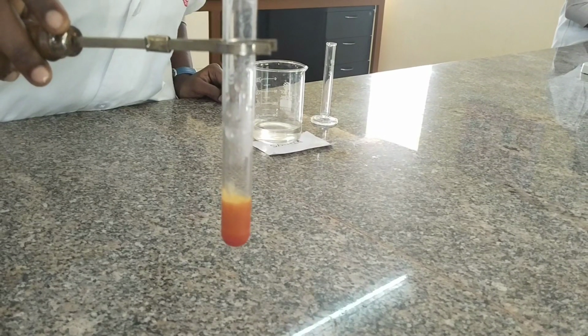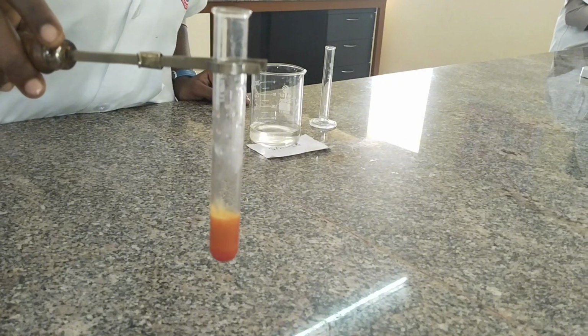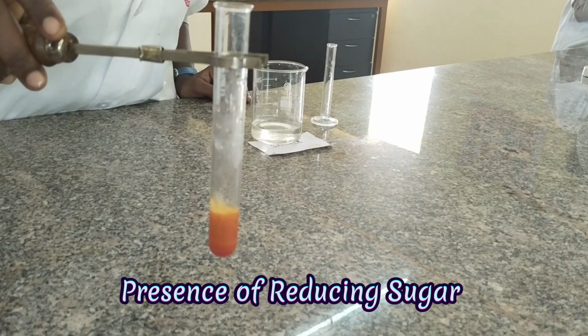Observation: a red color is obtained. Inference: presence of reducing sugar.